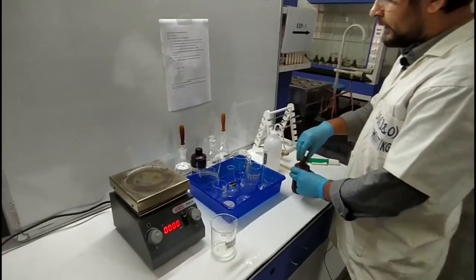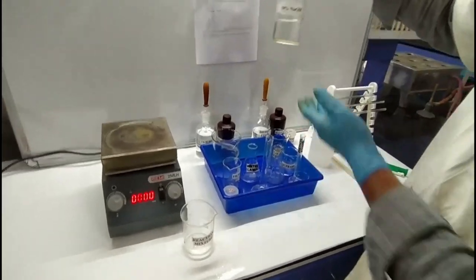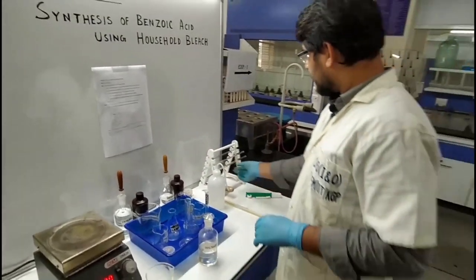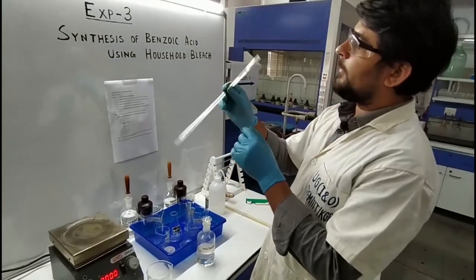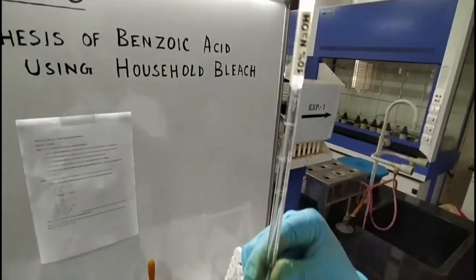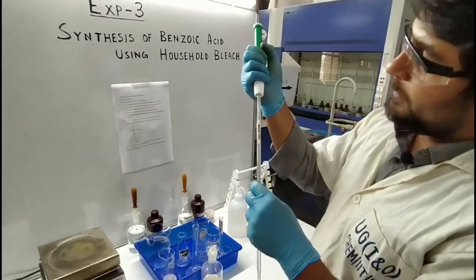Then after that, we have to add 2 ml of 10% NaOH. How much? 2 ml. To take 2 ml, we can find a pipette over here labeled as 10% NaOH. This pipette can measure only 2 ml. We have to take up to the zero mark, so again I am going to use the pipette pump.